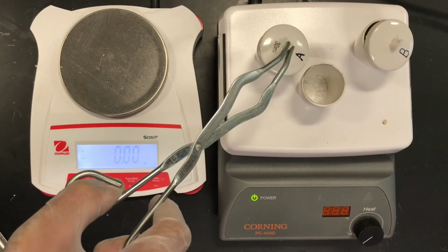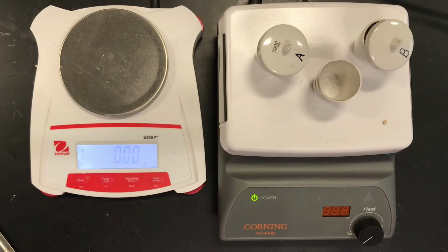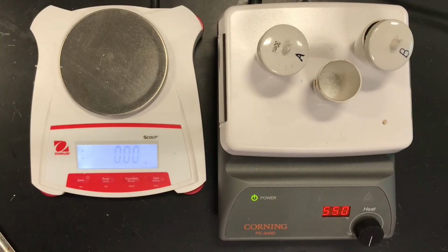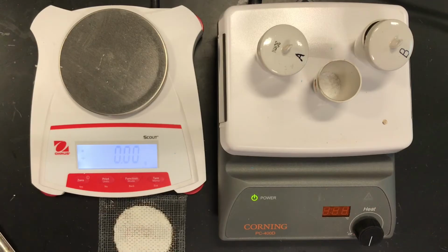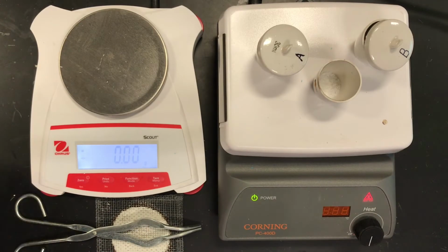All right, so here we go, leaving my reference crucible here just to see what's going on with the crystal. We're going to crank up our heat, and we're going to do our initial heating. And of course, what we're looking to do is drive off all the water. We don't know if that's going to happen until I do what? Mass out the cool room temperature hydrates and cover, and keep reheating until that mass stays constant.